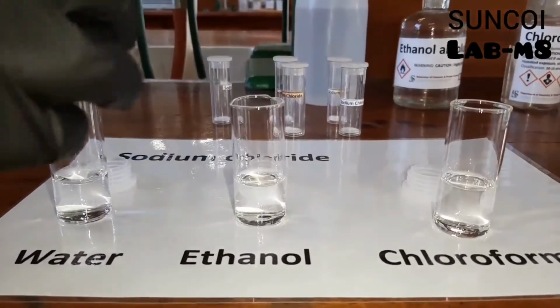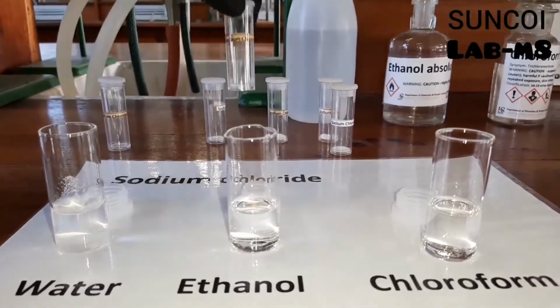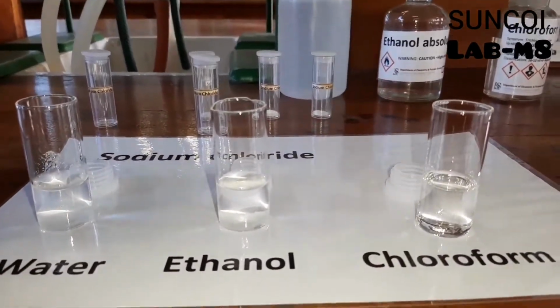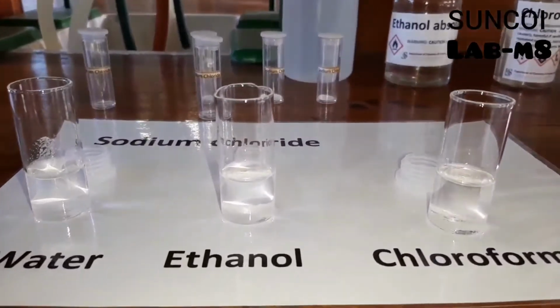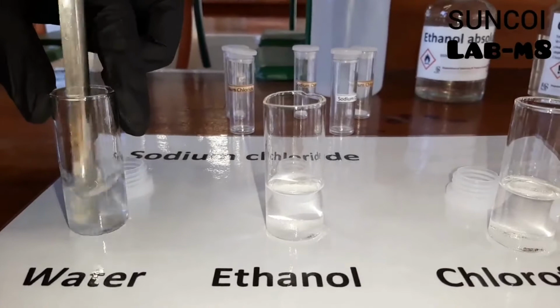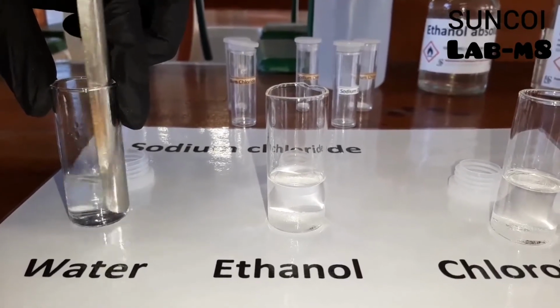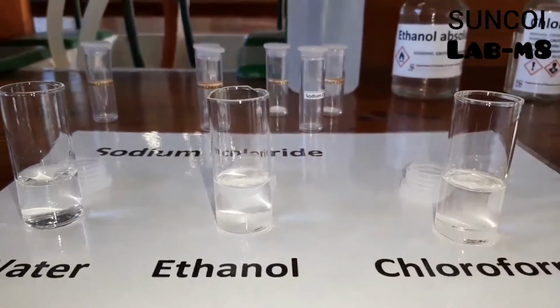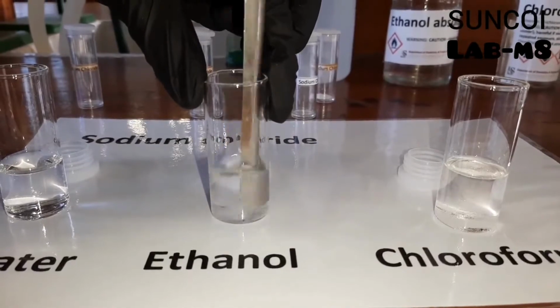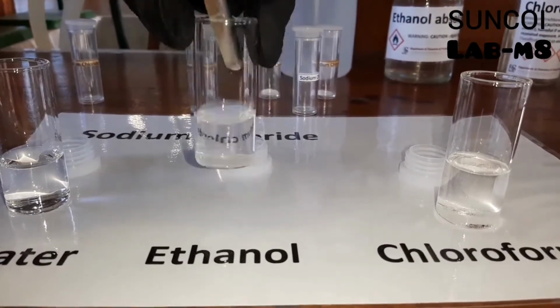So your second substance is sodium chloride. She's added it to water, again to ethanol, same salt, and then of course to chloroform. And then she's going to stir this. And you can clearly see the salt has dissolved in water. You know this already because you're always dissolving salt in water when you boil your pasta, for instance.